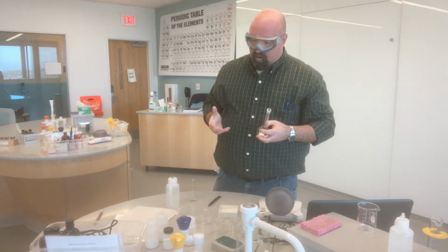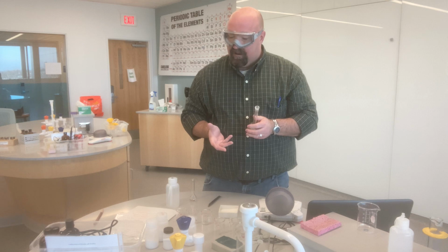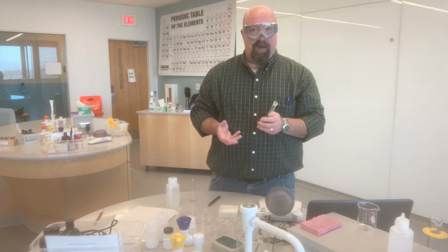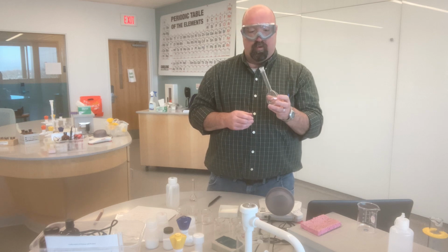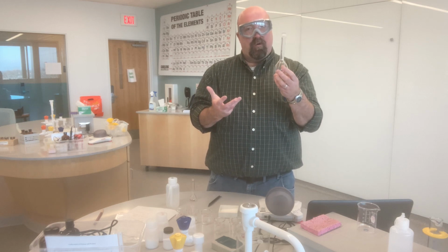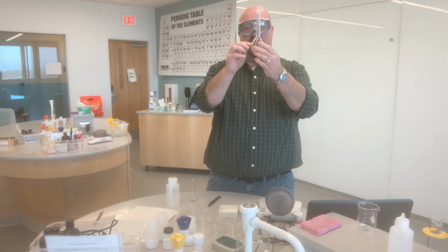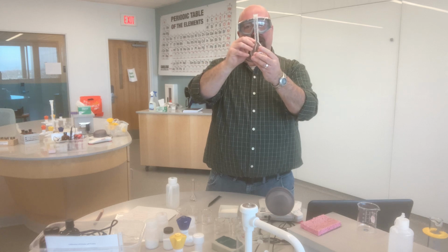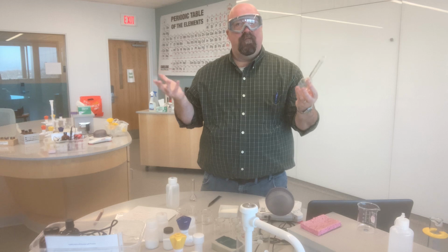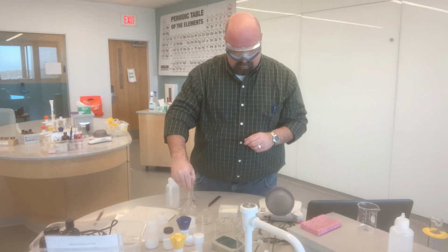And so what I'm going to do is mass out the amount of ammonium nitrate that I calculated I needed, which was 0.200 grams for 100 milliliters of a 0.025 molar solution. I'm going to mass out that amount, and then I'm going to add a little bit of water in here, halfway up the bulb or so. Then I'm going to pour in my actual solid, and then I'm going to fill up with water up to the line, and at that point I will have 100 milliliters of a 0.025 molar solution. And so let's go ahead and do that.